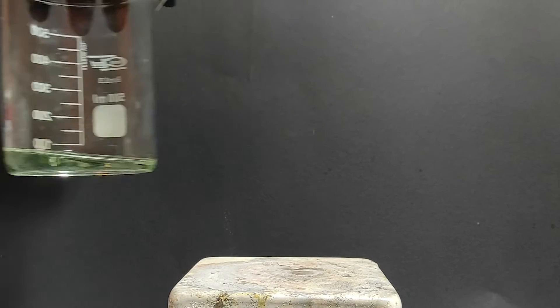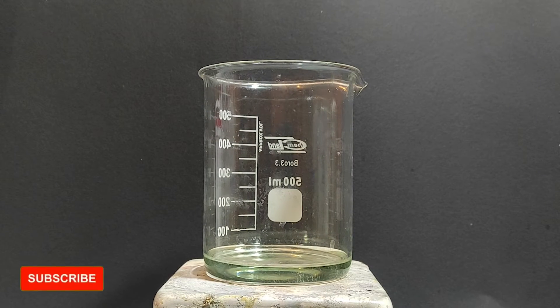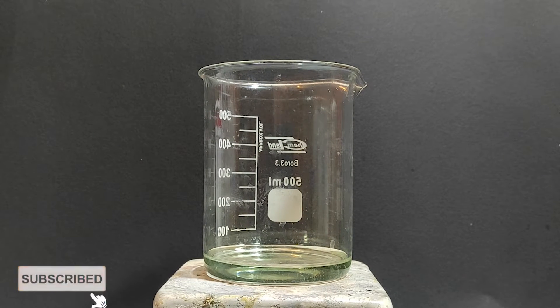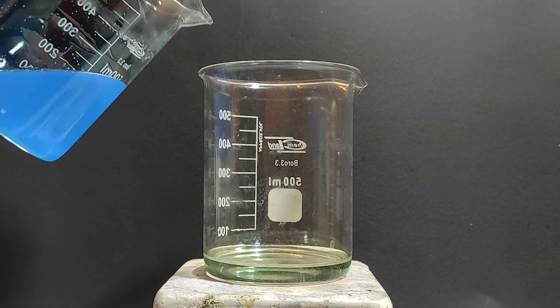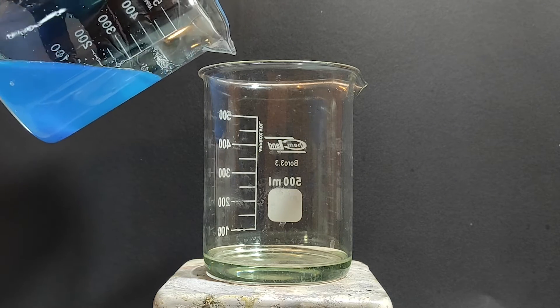I've put that solution aside and I've brought in the oxalic acid solution. In this solution there are some byproducts it's not really a pure one but it will do for the demonstration. Although I assume that you will just use the pure one from the store.